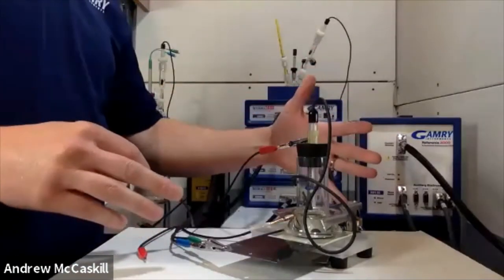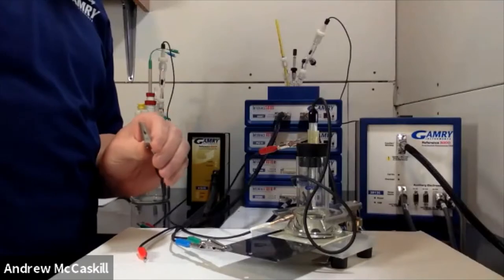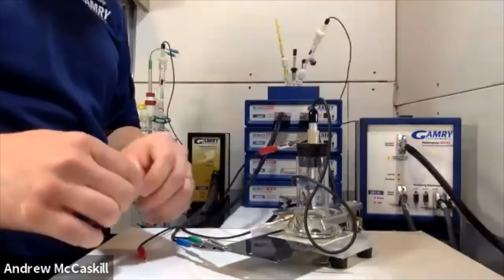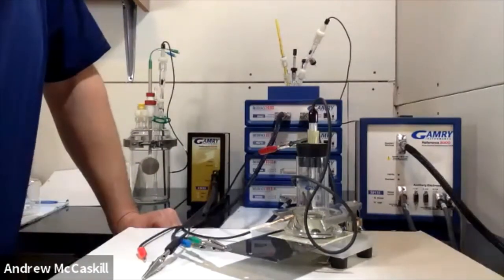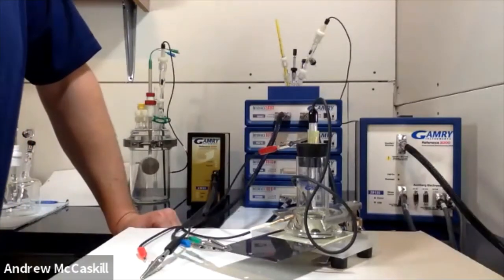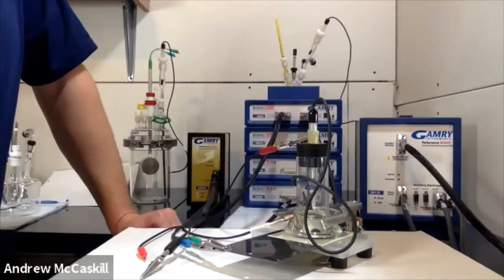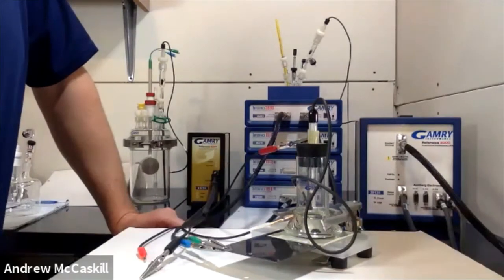The black pin helps improve accuracy and reduce noise — you might want to plug this into the exposed metallic area of a Faraday cage. So ideally you'd have everything enclosed inside a Faraday cage connected to an exposed metallic surface, and you'd be ready to run your experiments with the Paint Test Cell. Applications for this cell would of course include coated samples; you could have this setup running for days, weeks, or months and collect good data.